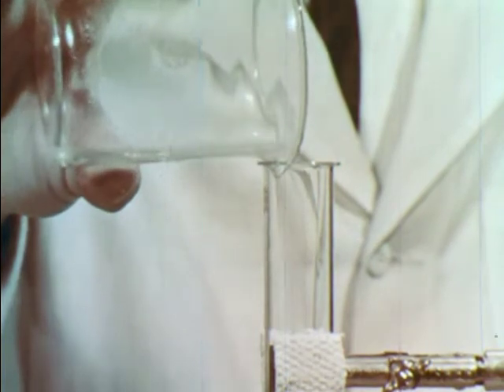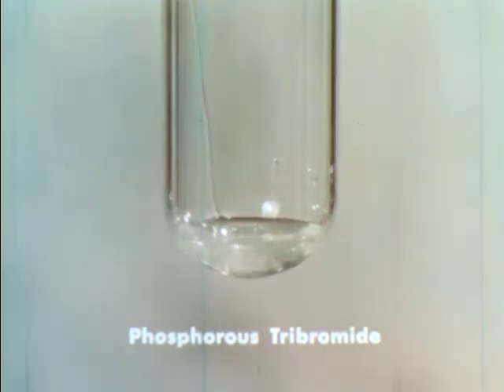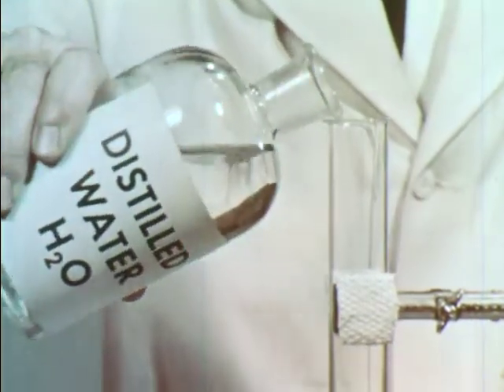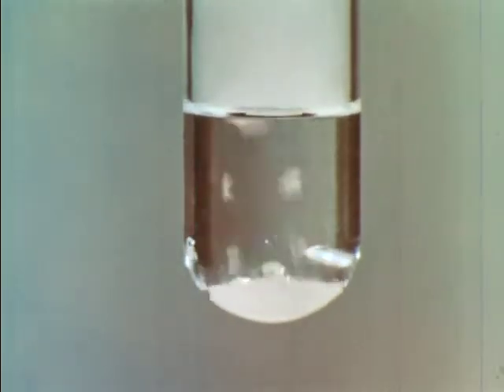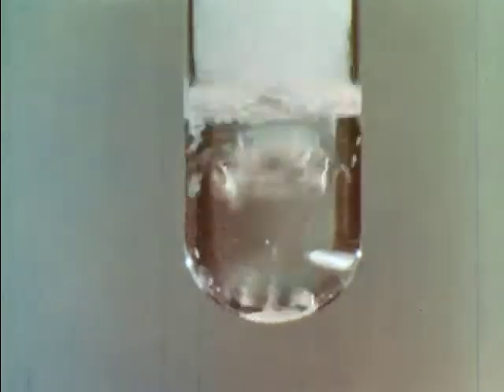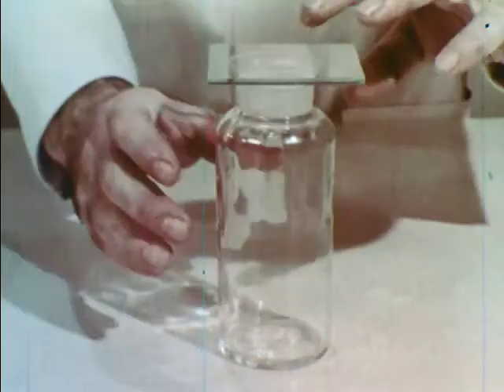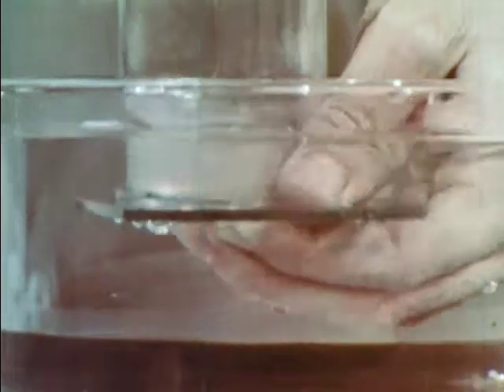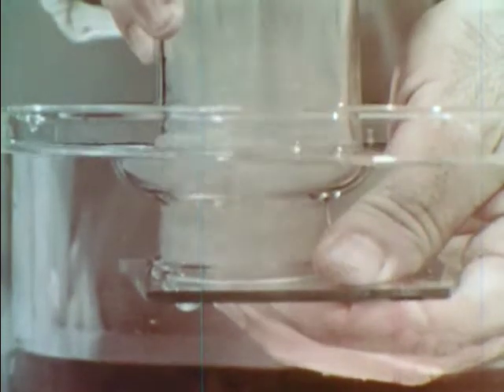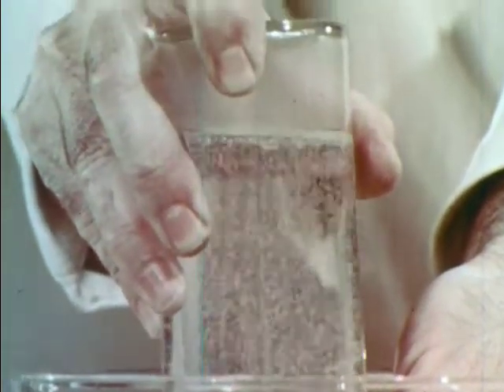Here's the purified product from the phosphorus and bromine reaction. Phosphorus tribromide is a liquid. Again, we'll add water. The reaction starts slowly but soon gives off so much heat that bubbles of steam are formed, and continues until all the phosphorus tribromide has dissolved. This bottle contains pure hydrogen bromide, the product of the earlier reaction between hydrogen and bromine. When we let hydrogen bromide come in contact with water, we see that the water level rises rapidly, indicating that hydrogen bromide too is very soluble in water.